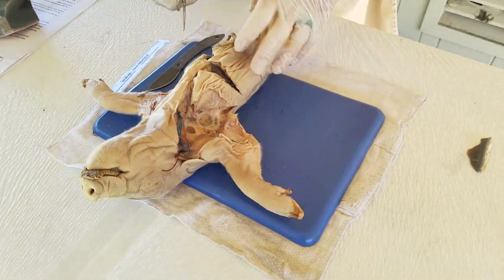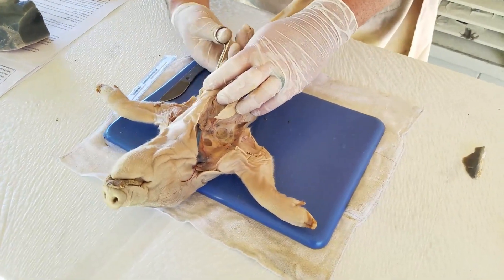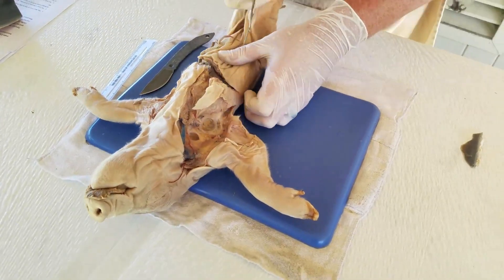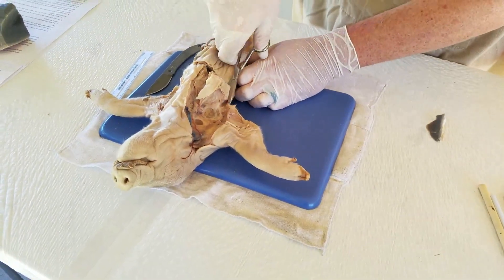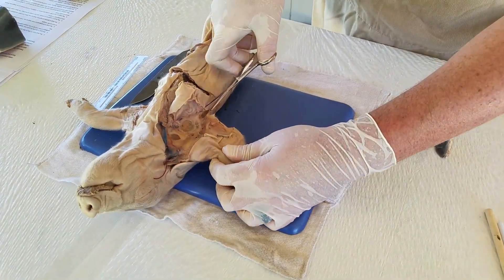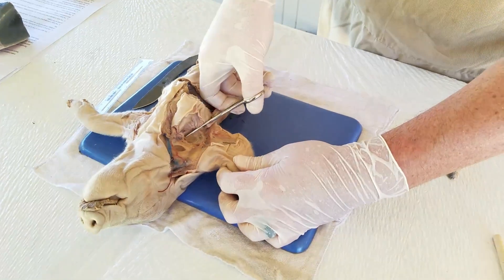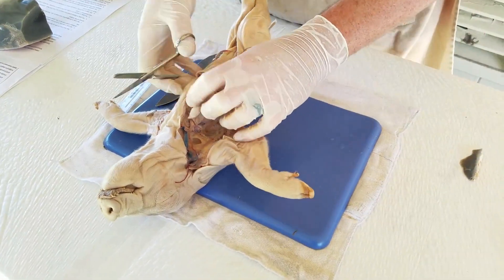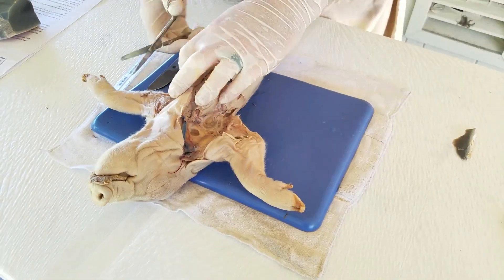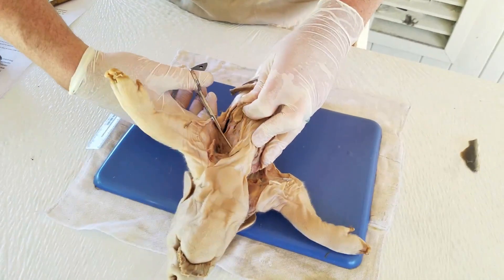So we've got our Y incision — definitely a little nastier than I normally would do. We've got them opened up here and we're looking for the rib cage. I'm going to switch from scalpel to scissors and cut into the rib cage area. This guy's got some pretty soft ribs. My wife just reminded me I should probably tell you what we're dealing with here: this is not a full-grown pig — this is a fetal pig. Someone usually asks: 'Hey Mr. Menifee, why are you killing pigs?' I'm not killing pigs, guys. Literally, we buy them this way. They are stillborn from slaughterhouses — these are pigs that were going to die one way or another. We're just using them for scientific purposes.